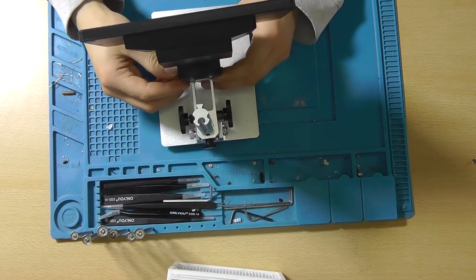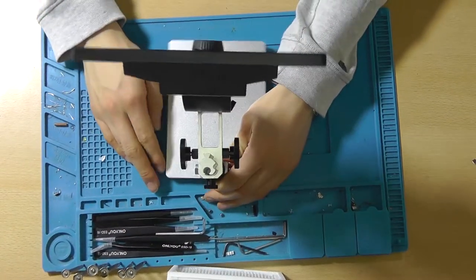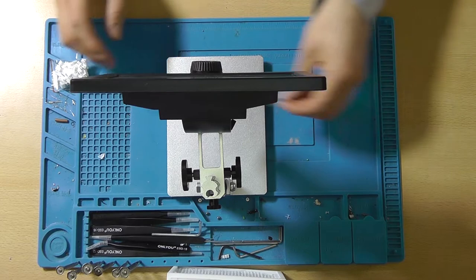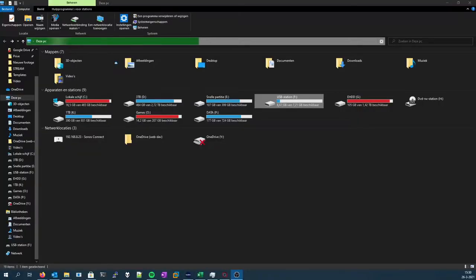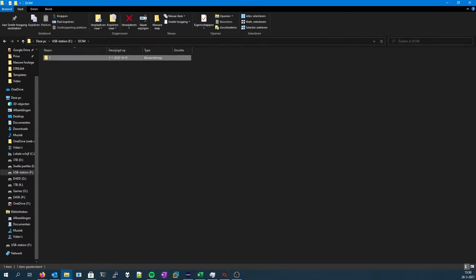Now there's still one thing to do, and that is to actually record a video. So it's recording. Let's take a look at this clip. So let's stop the recording and let's check on the computer what has actually happened. So I've inserted the micro SD card into my computer and let's actually browse the contents to see what has actually happened. Hey, timestamp. So that's exactly what I wanted.